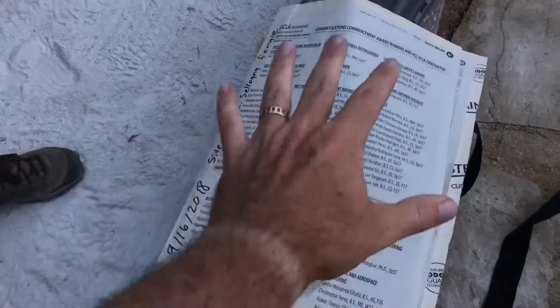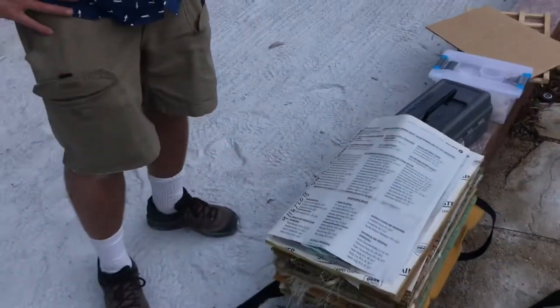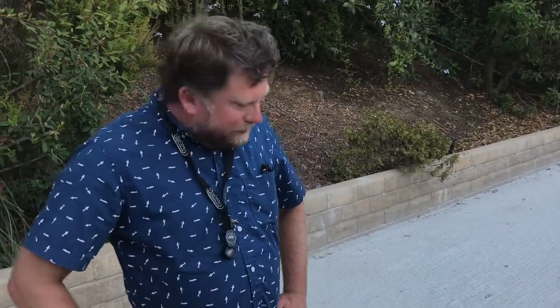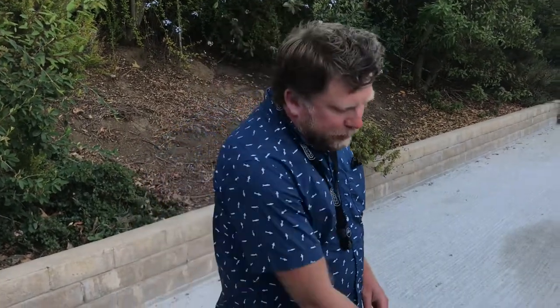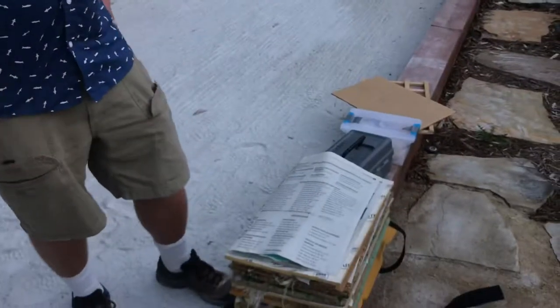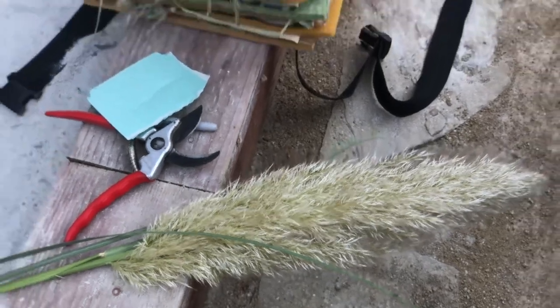Sometimes when we look at archival herbarium specimens, there'll be an envelope on the archival sheet with seeds or other particularly sensitive or small structures that might flake off. You can put stuff in an envelope now or press it separately, then add them to the same sheet. The other thing is that now, in addition to collecting these pressed specimens, folks are also routinely collecting leaf samples for genetic analysis — that's often done in conjunction with this as well. We'll do that next.